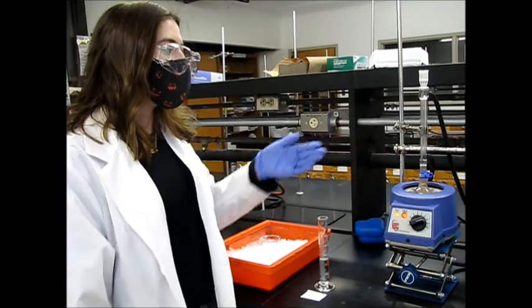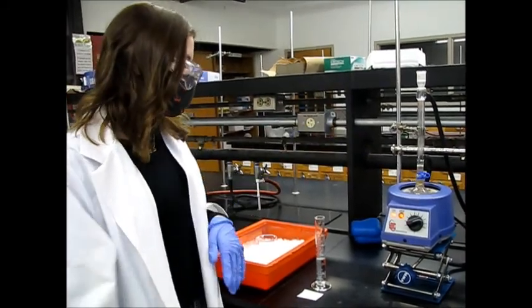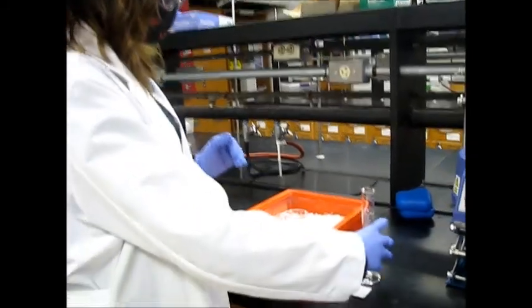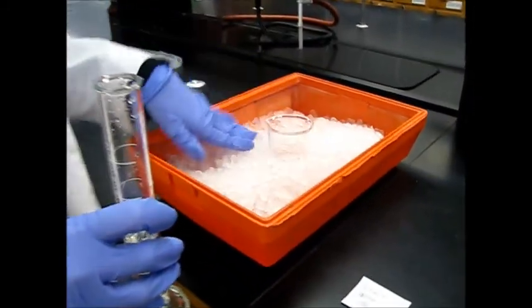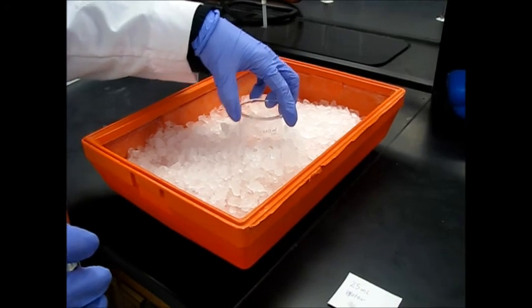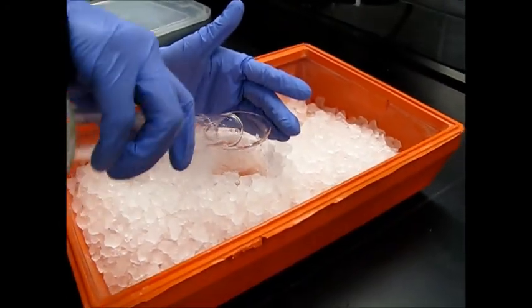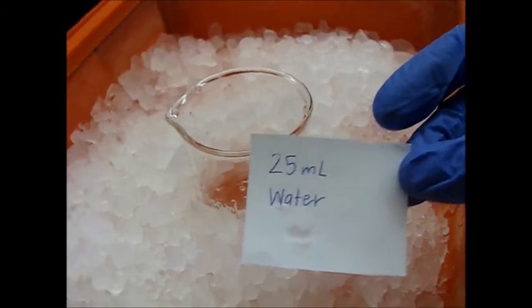So while you're waiting for your reflux, you can go ahead and set up your ice bath to cool down 25 milliliters of water. So we just have our ice in here, a 150 milliliter beaker. We can just go ahead and put our water in there and let it get nice and cold while we wait. So this is the 25 milliliter water.